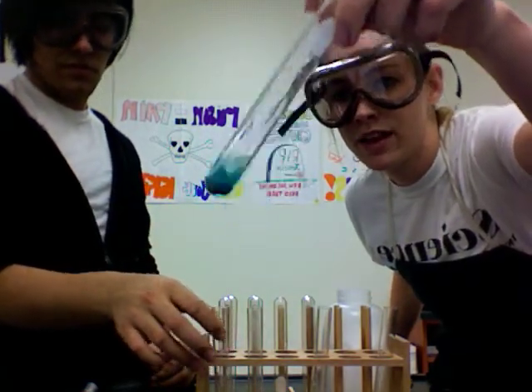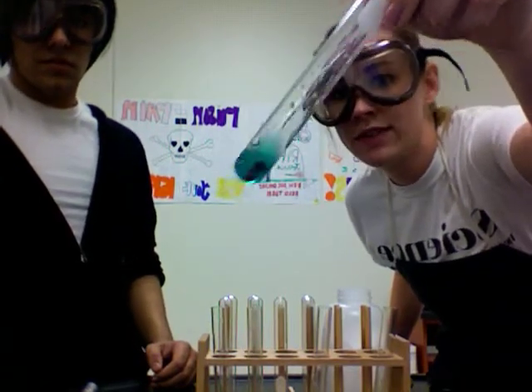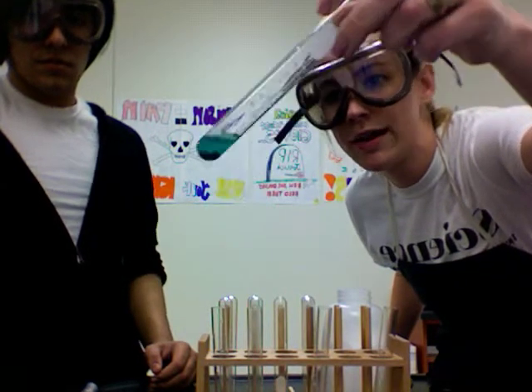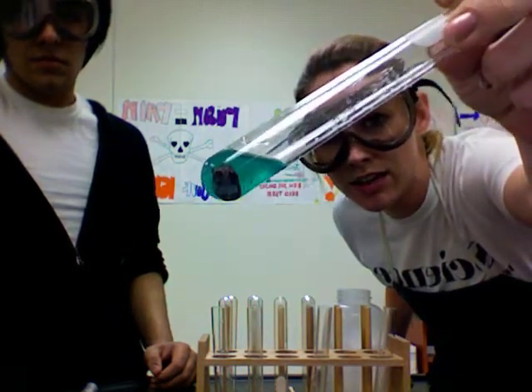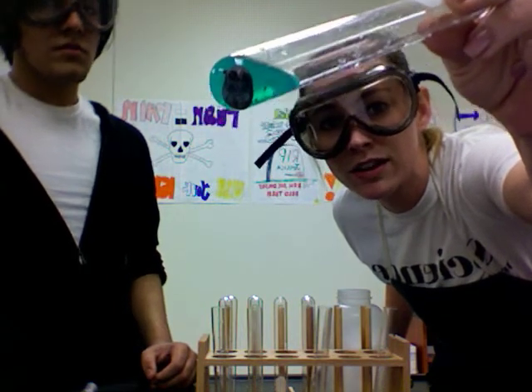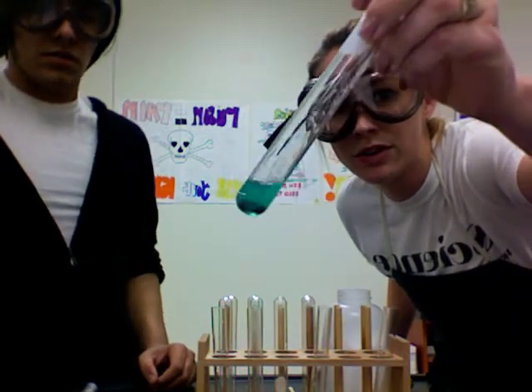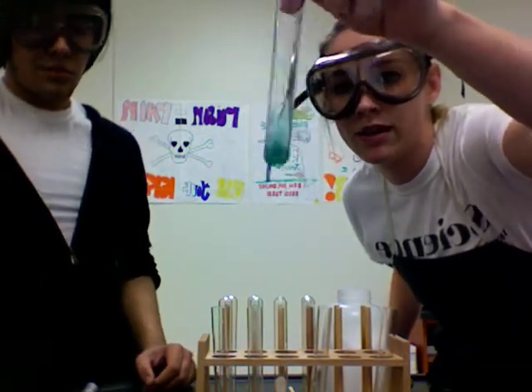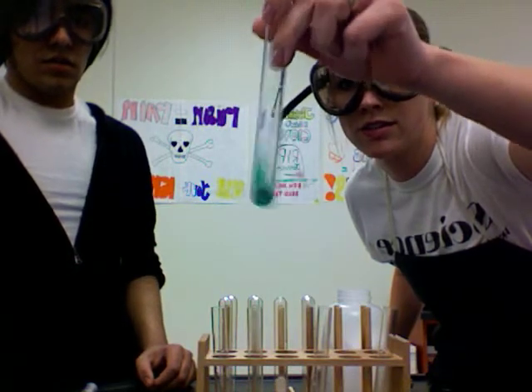Kind of shake it around and you'll see that the blue of the copper chloride will start to go away. Of course, now that I'm saying this, it's not going to. But what you can see is that our zinc is no longer silver because it's not zinc anymore — it's starting to be replaced with copper, and copper is kind of that reddy brown color. You can see some of the color is starting to go away, and it'll go away the longer this thing reacts.